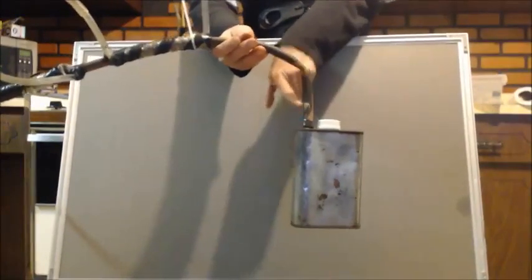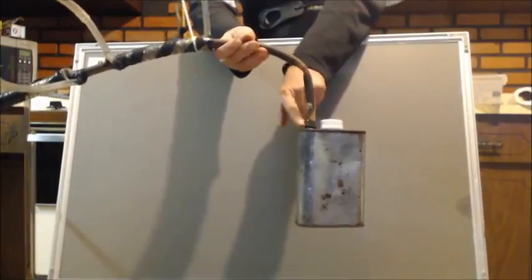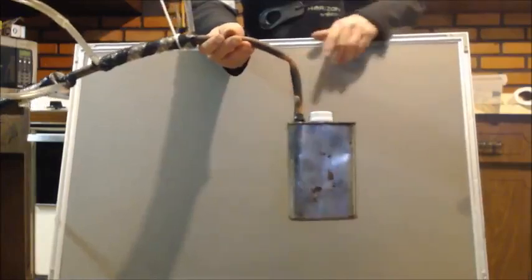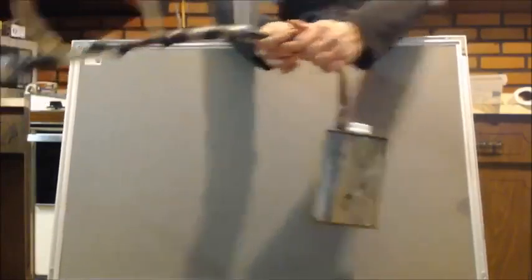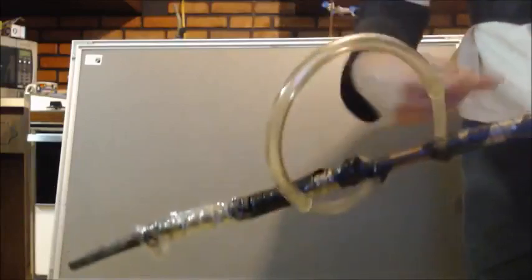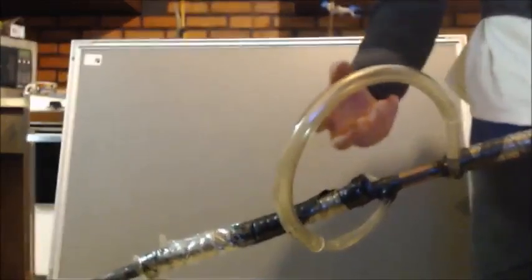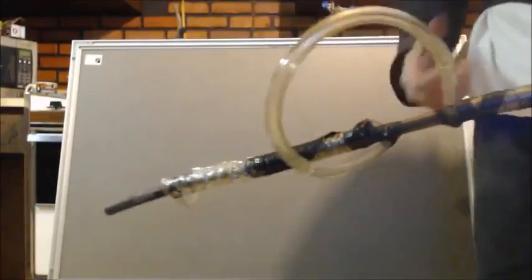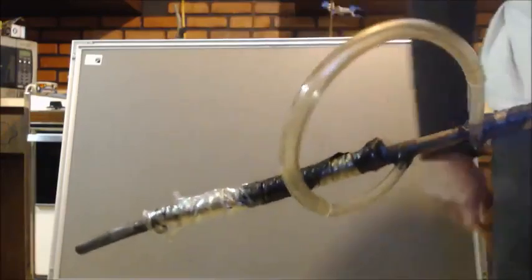So anyways, I did end up putting the can on. You can see this is the same can, I left that port on there and I put this right over the port and welded it to the port and the can. And then, as you can see, I got plastic. Here's my in. You can see I wrapped it around and I put tape on it. Actually two different kinds of tape. This right here is because I didn't have a long enough tubing to be the same tube. So this is actually a bigger piece than the rest of it, so it wasn't going around right. It was kinking up, so I had to leave it out like that.